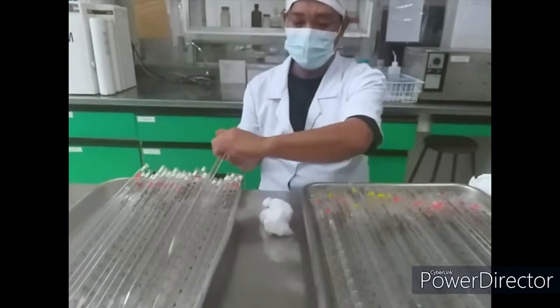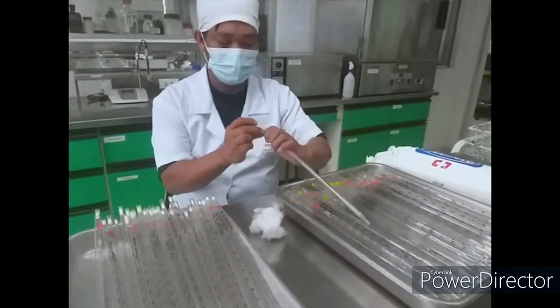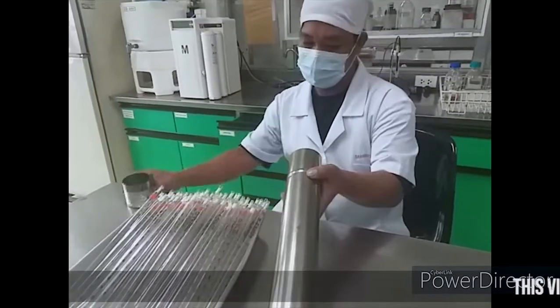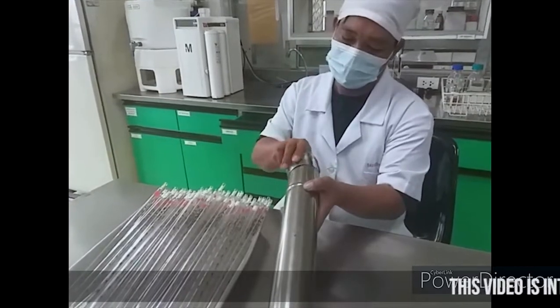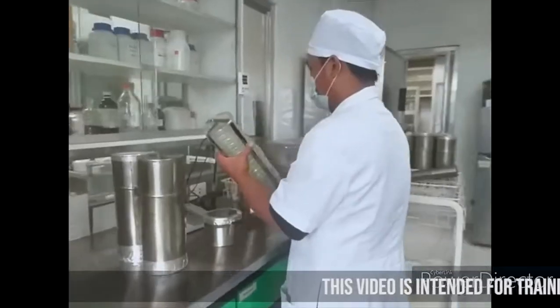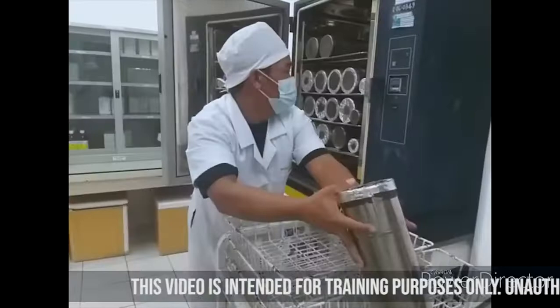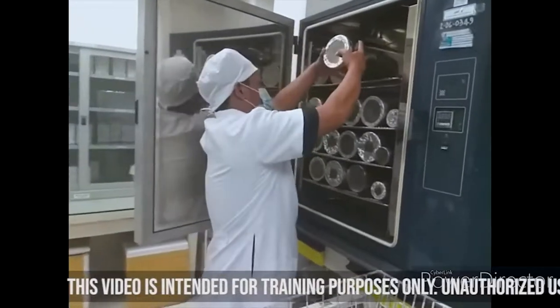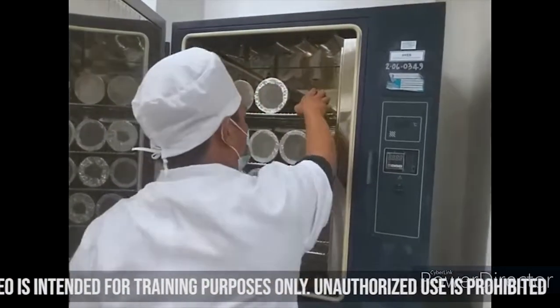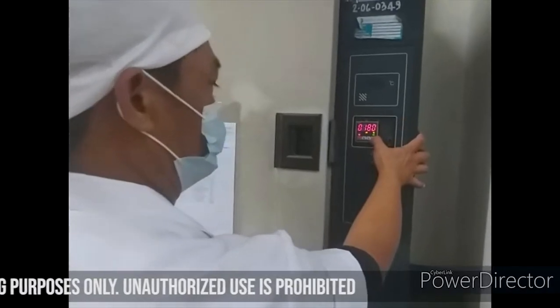Glassware such as plates and pipettes are sterilized using dry heat sterilization. Cotton plugs are put on the pipettes before sterilization. The plates and pipettes are put into a metal canister, which is then placed inside the oven and sterilized at 180 degrees Celsius for 2 hours.